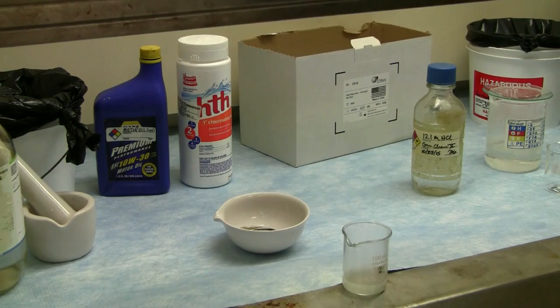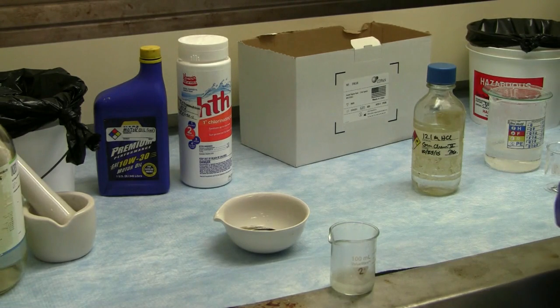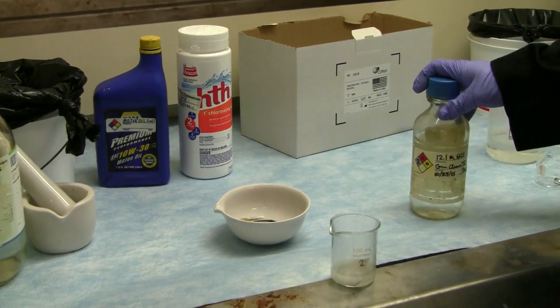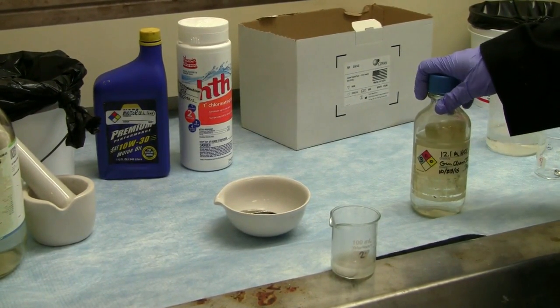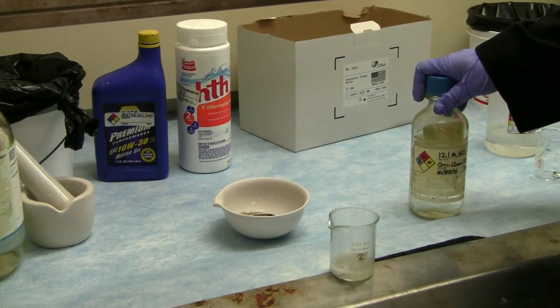So like I said, what we have here, the aluminum is reacting with the hydrochloric acid to create aluminum chloride, and we're also creating hydrogen gas as a result. I like to use this one because it's always important to know what your container is, what's your vessel, what is the proper container for this particular chemical. A lot of times you don't want to put acids and metal together because they generally don't mix well. They are reactive and incompatible with each other.